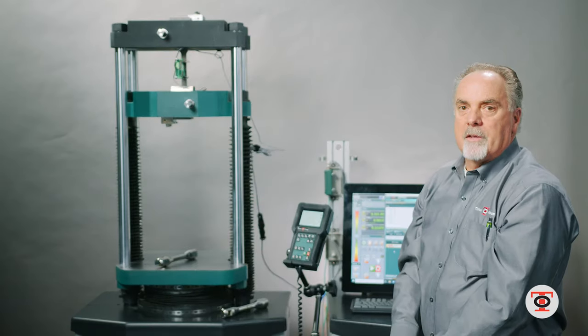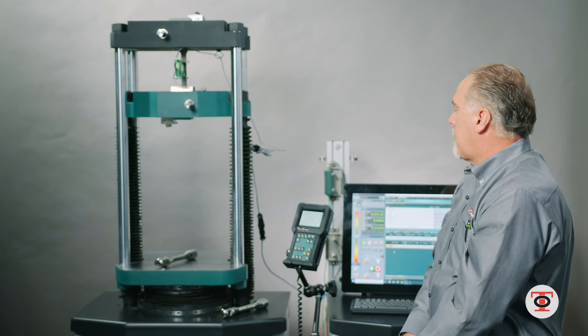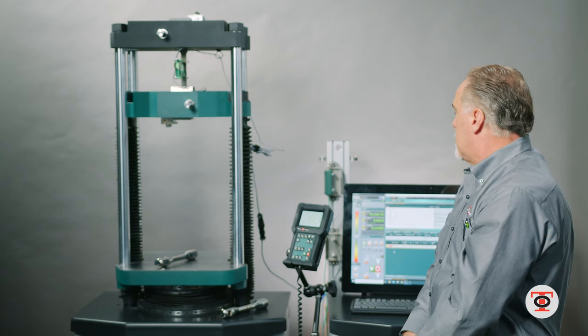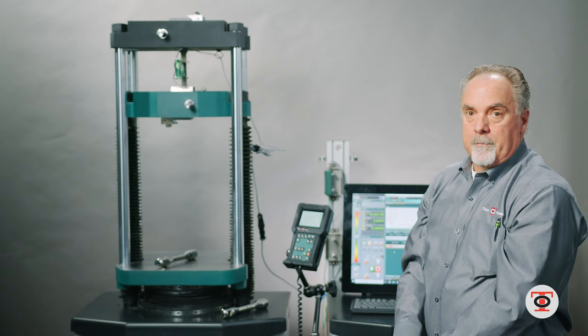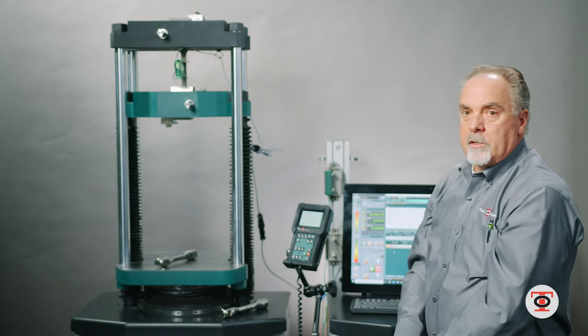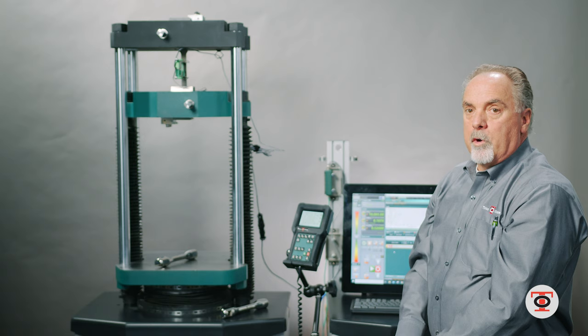I am almost at 10,000 pounds. The material is now yielding and I will wait for the message to remove the instrument.